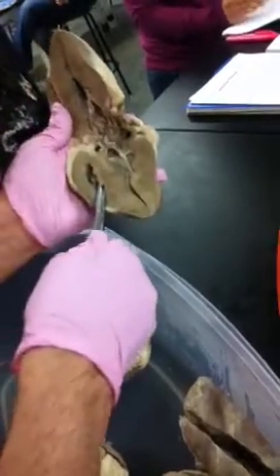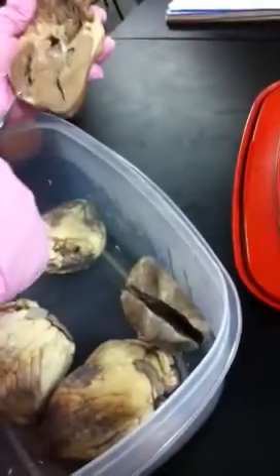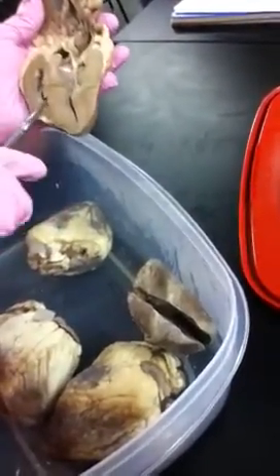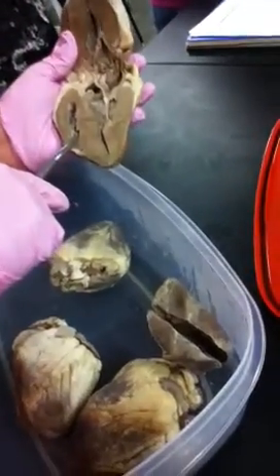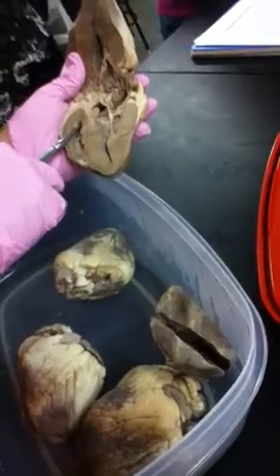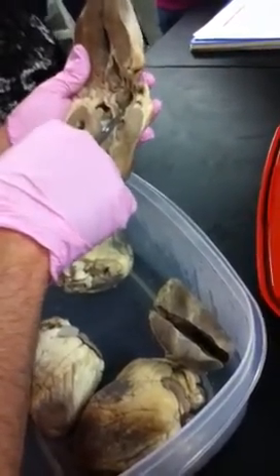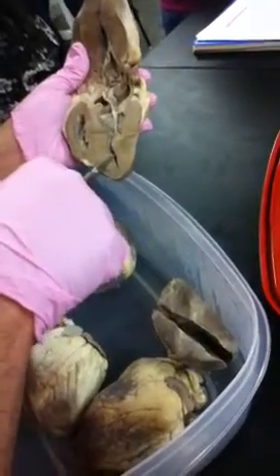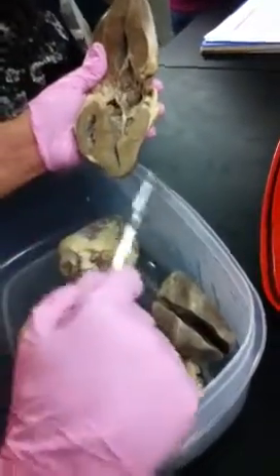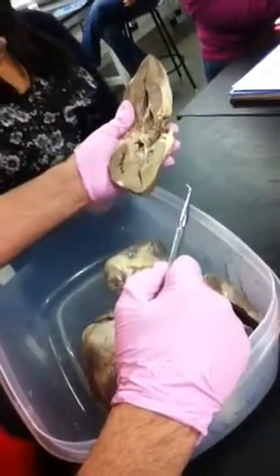pulmonary trunk. Okay, right. So again, I have to clearly show you a right atrium and a right ventricle. So if it's in the right ventricle, pulmonary trunk, or you could say pulmonary arteries; right atrium, inferior, superior vena cava; left atrium, pulmonary veins; left ventricle. Exactly. Anything else on there? Left ventricle is aorta. Papillary muscles.